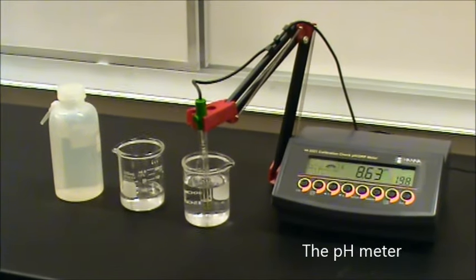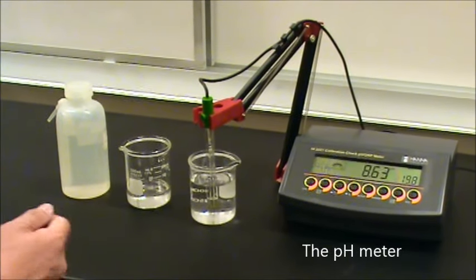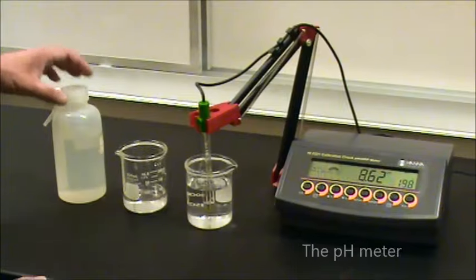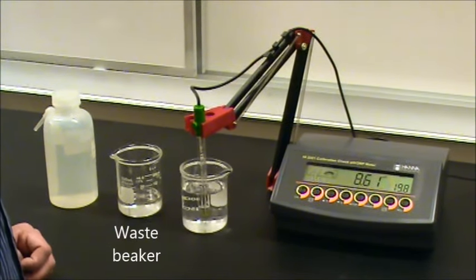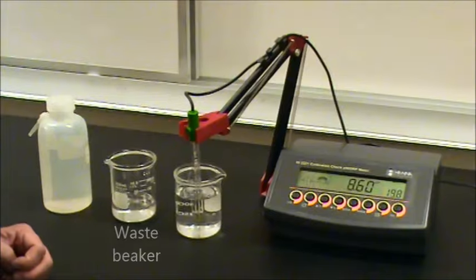This is a pH meter and there's a certain procedure to using it. Part of that procedure will help ensure the functioning of the meter and also guarantee that you'll get a good measurement.